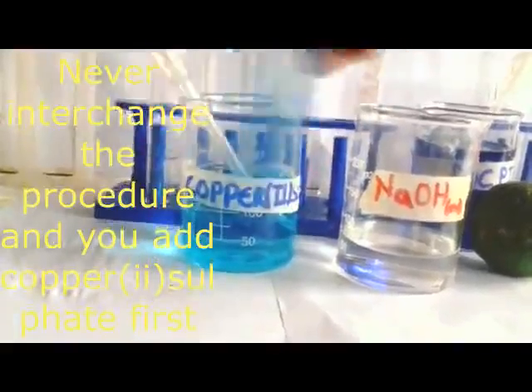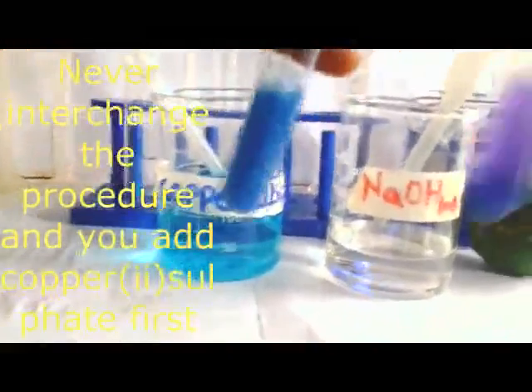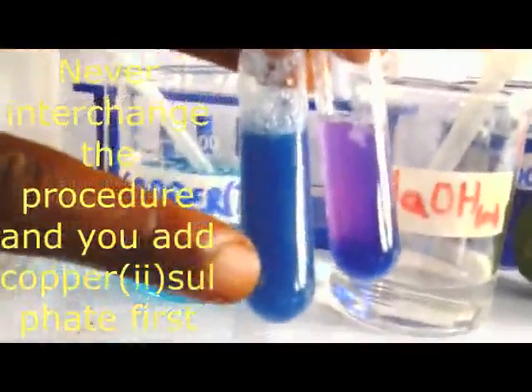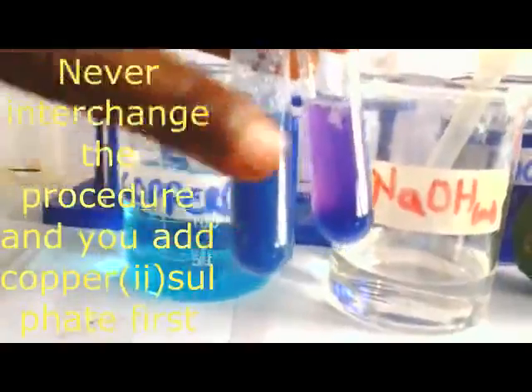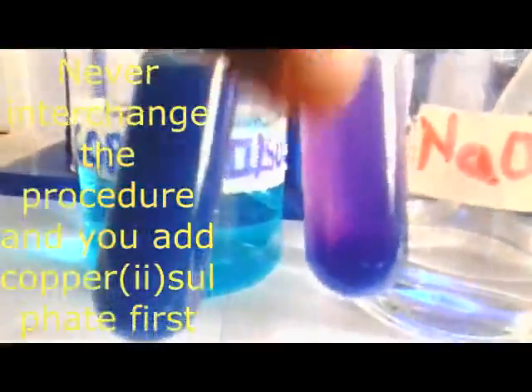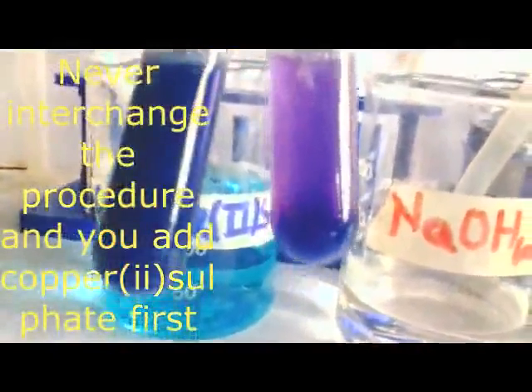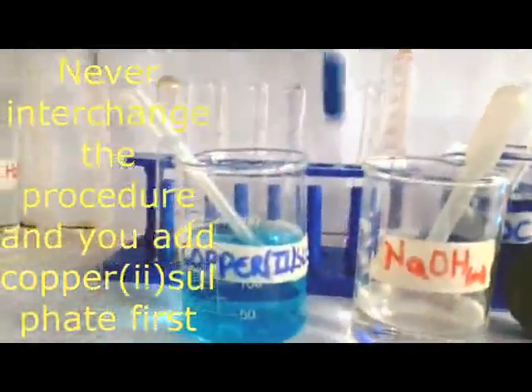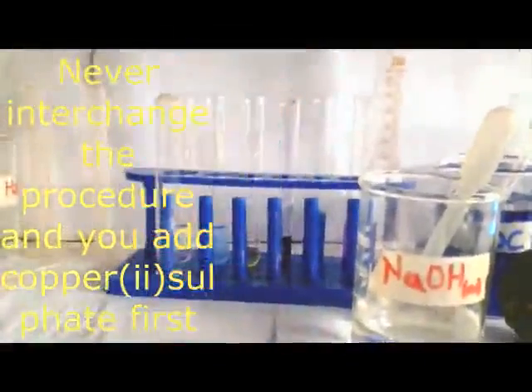Now when I shake properly, you can see, you get this one, the one where we have reversed the procedure, and this one is the right procedure. Here you are going to obtain blue precipitates when you have reversed the procedure. When you have used the correct procedure, we are getting a violet or purple solution. So take note, never reverse and put copper 2 sulfate first. It should be sodium hydroxide first, for better results.